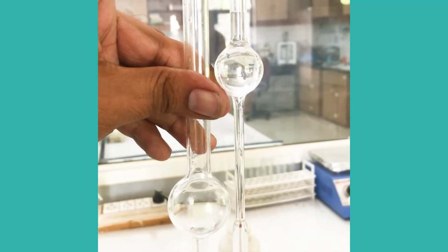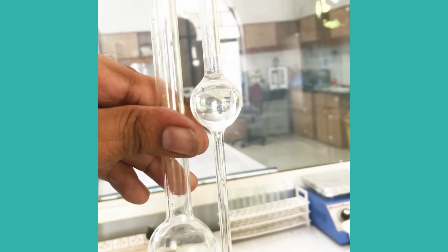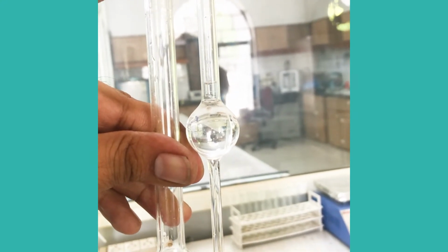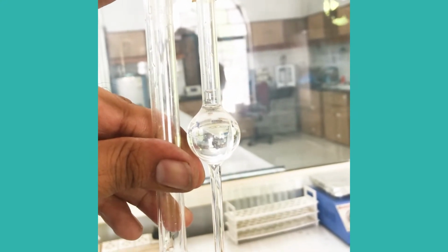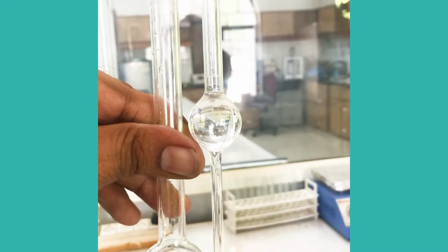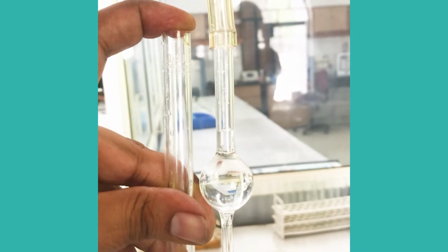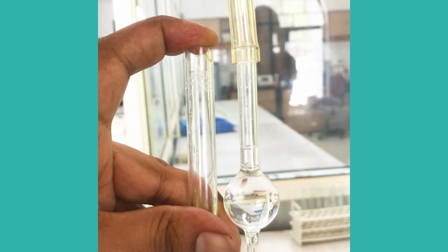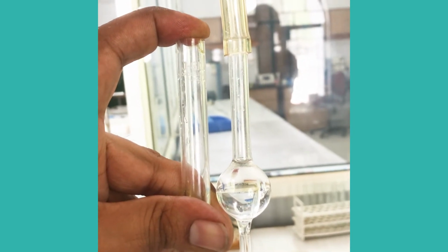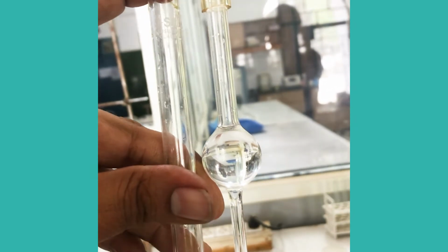Now bring this solution to the right side of the viscometer above the start mark, and as soon as we leave our finger, we'll be recording. As soon as the solution passes our stop measuring level, we'll stop the stopwatch.